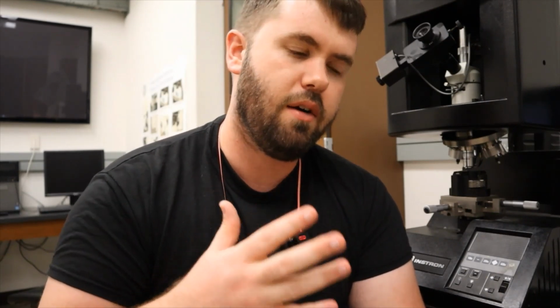Now the second part of the lab requires using the optical microscope to get microstructure images of our different unknown samples. So we're going to go to the microscope right behind the camera, and I'm going to pick 3 samples, and we're going to look at the microstructure mostly to show you that even though they're all copper silver, we can get very, very different microstructures.